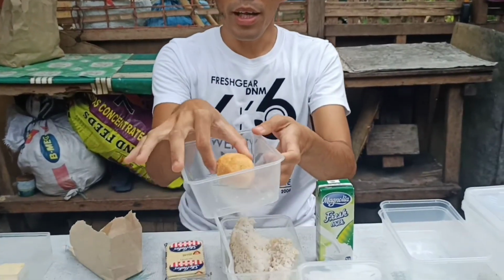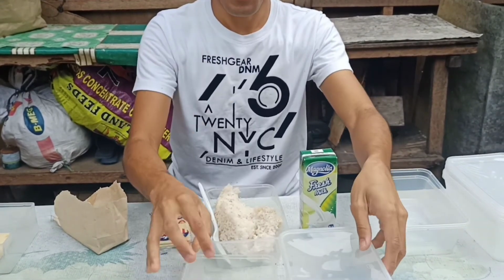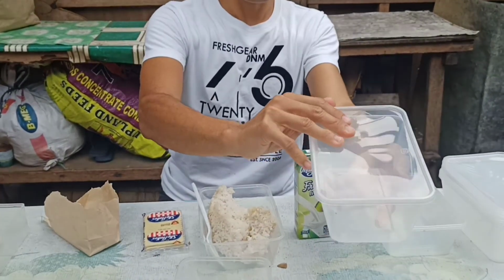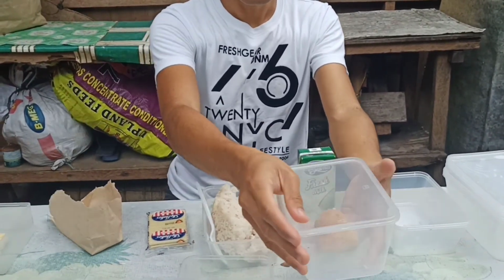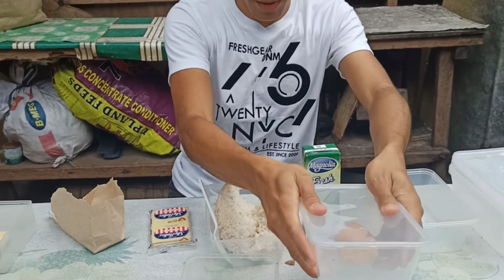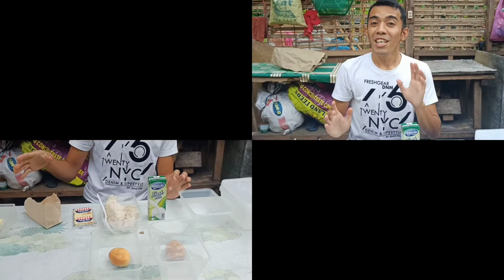For example, we put one bread in the open system setup, and the other bread will be placed in a closed system setup. I am going to do the same to all the ingredients. Just give me a minute to prepare all of this and I'll be right back.